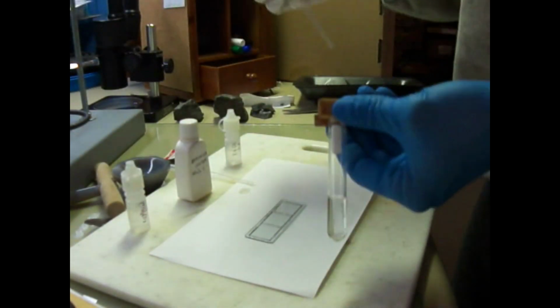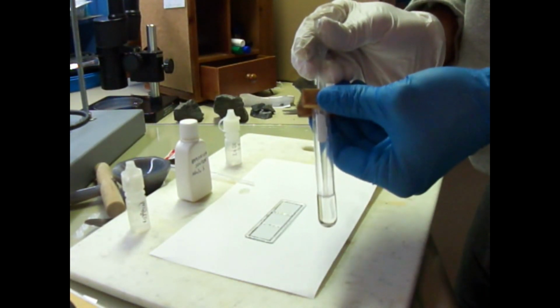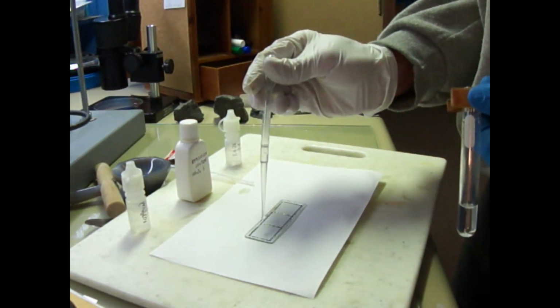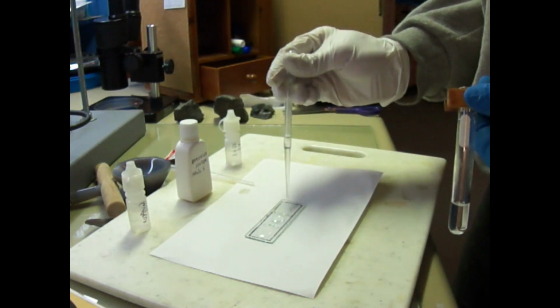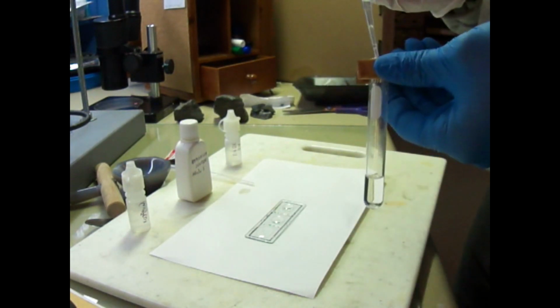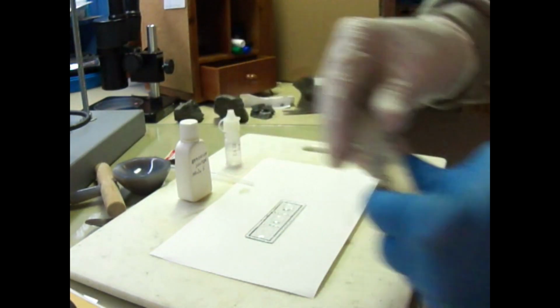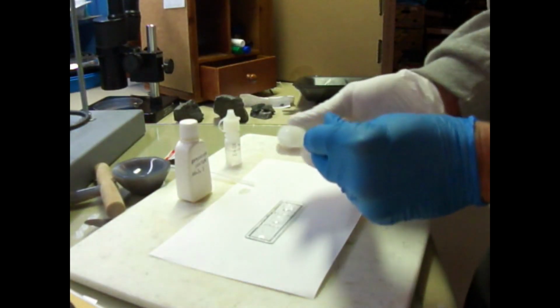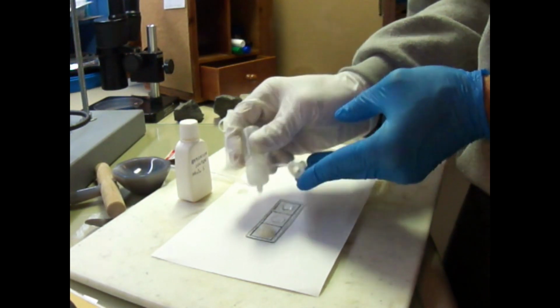We're going to take what we dissolved in acid, take a few drops, and do a series of spot tests. I have 3 compartments on this microscope slide. I'm going to put 2 drops in each compartment. And then, to the first one we'll add ammonium carbonate solution. And we're going to get some fizzing because of the acid that we dissolved it in.